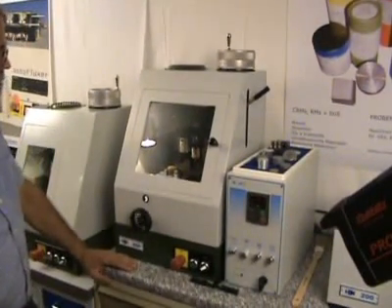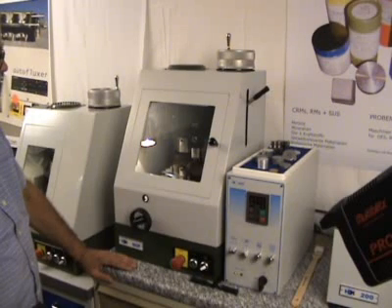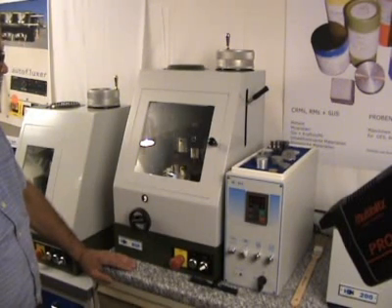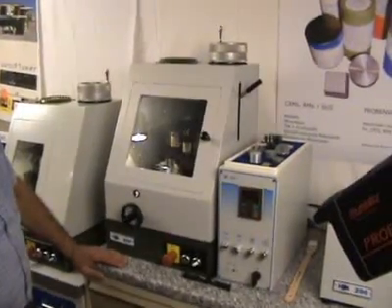The machine is started and the sample travels forward under the cutting head to be milled.